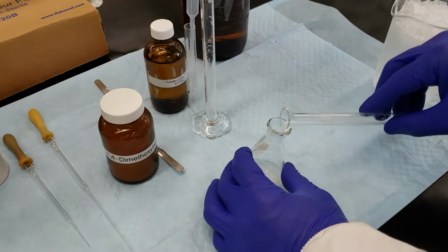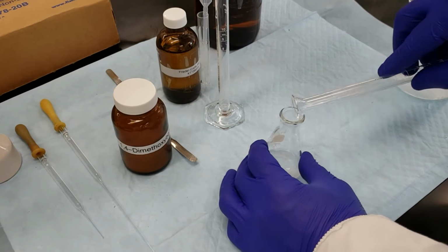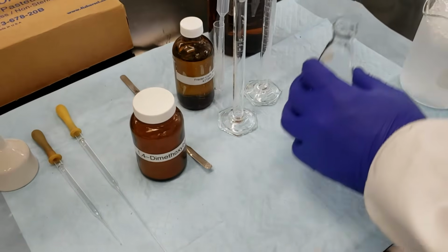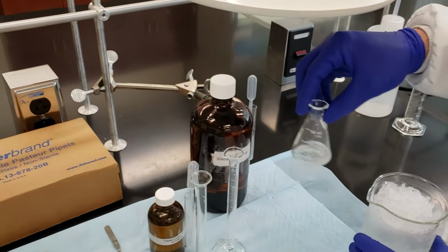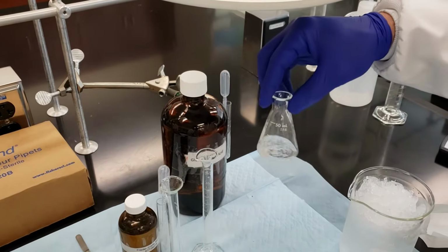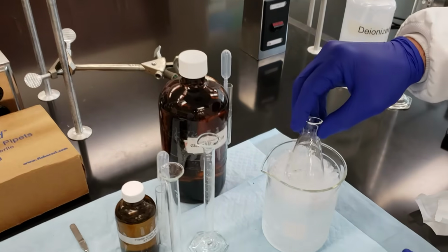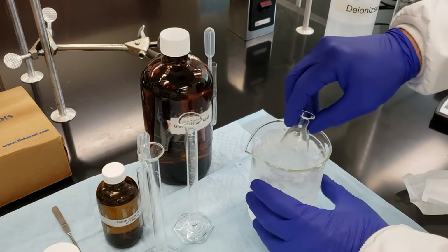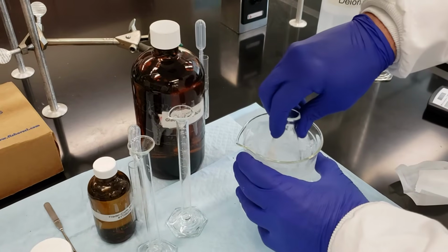Here's our glacial acetic acid. Very strong odor, so we're keeping our snorkel in place here. So we're going to mix that just a little bit here. Now, as of right now, these components alone are not going to react. We're going to have to add in our sulfuric acid, but the first thing that we'll do is place it in an ice bath before we go get the acid out of the hood and bring it back over so that we can add it dropwise.